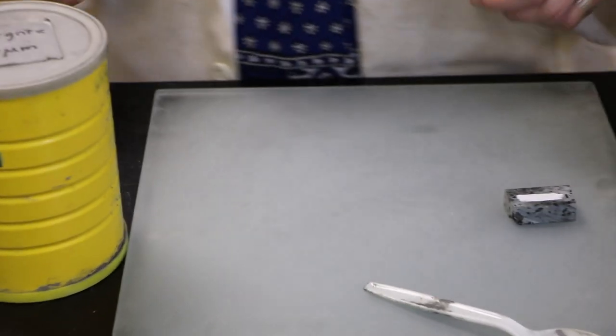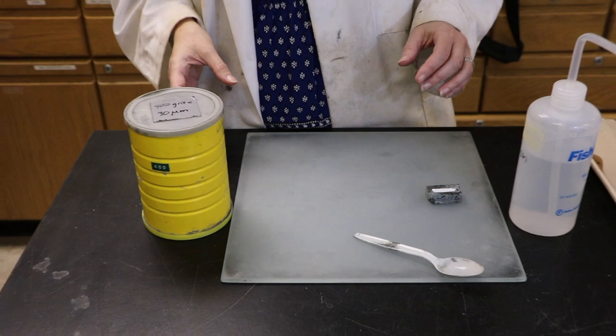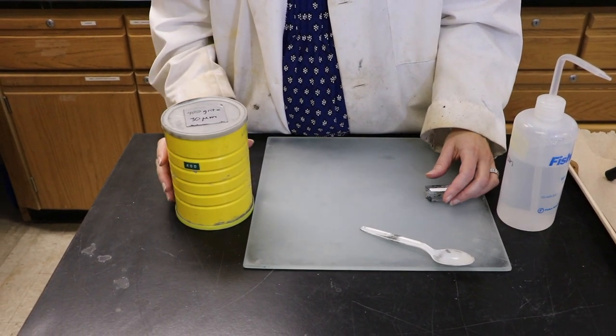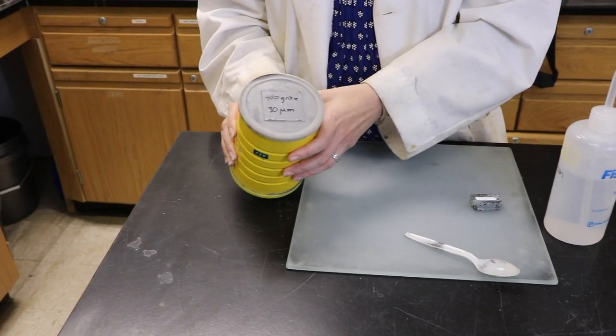Hi, this is Dr. J. In this video I want to show you how to polish items on a glass plate using polishing powder.